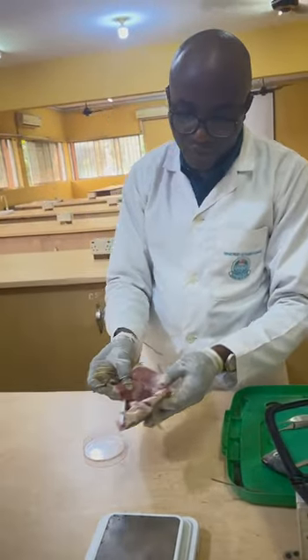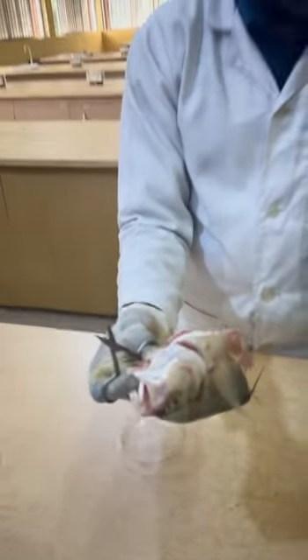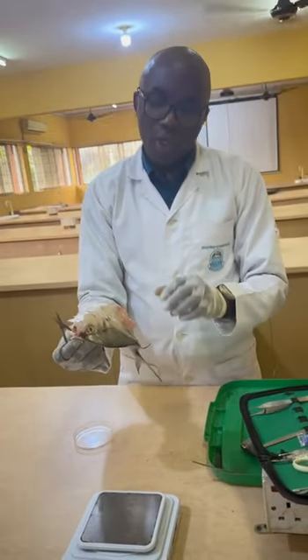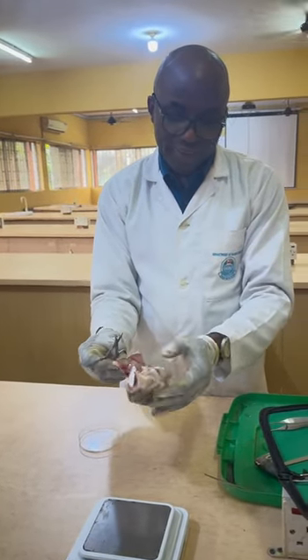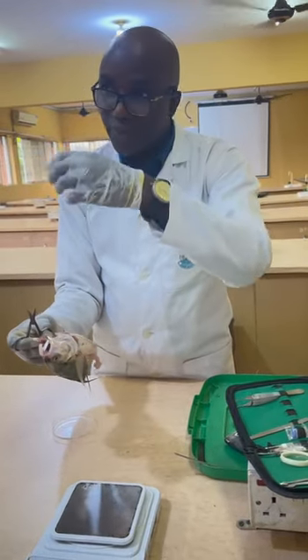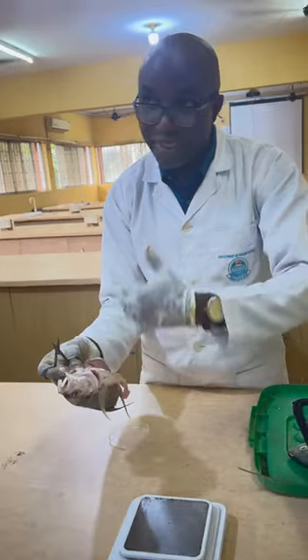For instance, like this fish now, you can record, except you have read in literature for this fish to know what its size at maturity is. So if you don't have that information, you may assume that a fish like this is immature. But another thing is that, maybe due to the exposure, depending on the timing the fishermen caught it and the rest, some spoilage will have occurred to the internal organs.